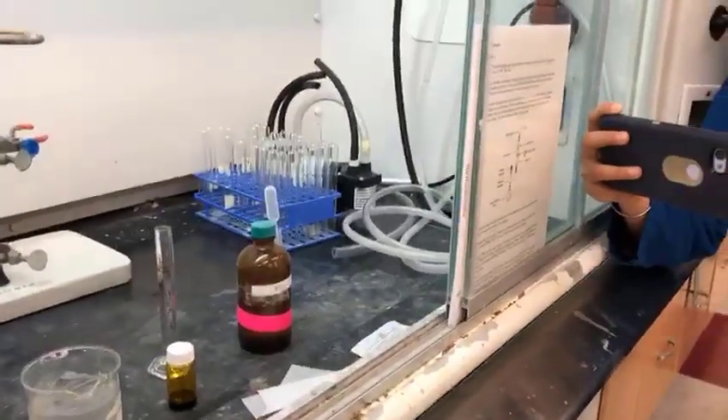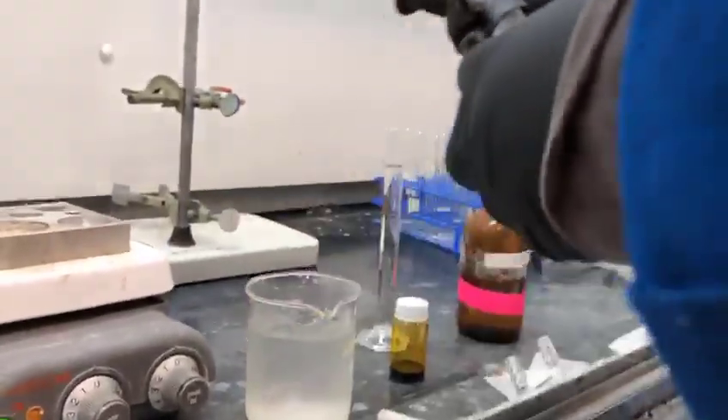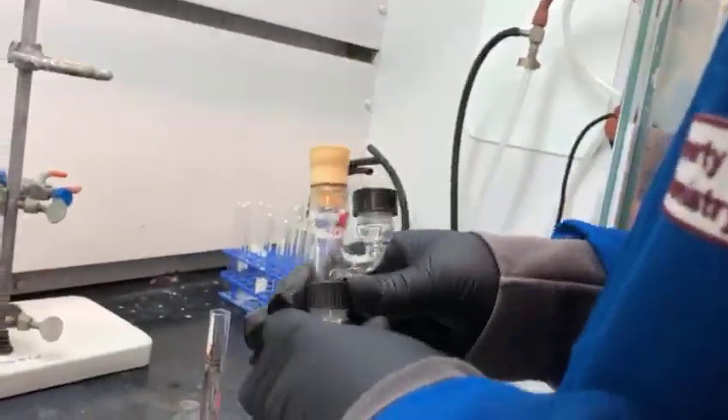This will be loaded onto a syringe that will be injected. Unfortunately we are not going to see this injection — that video clip was not taken.